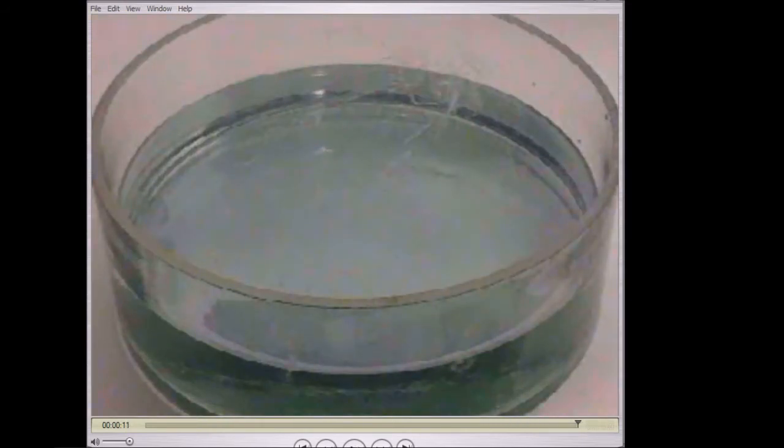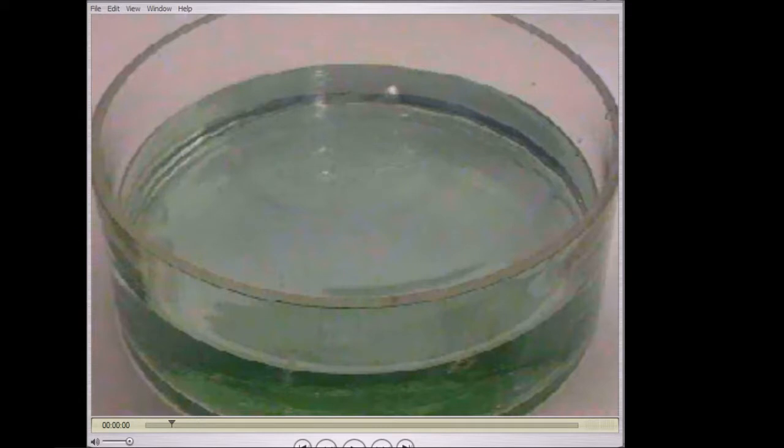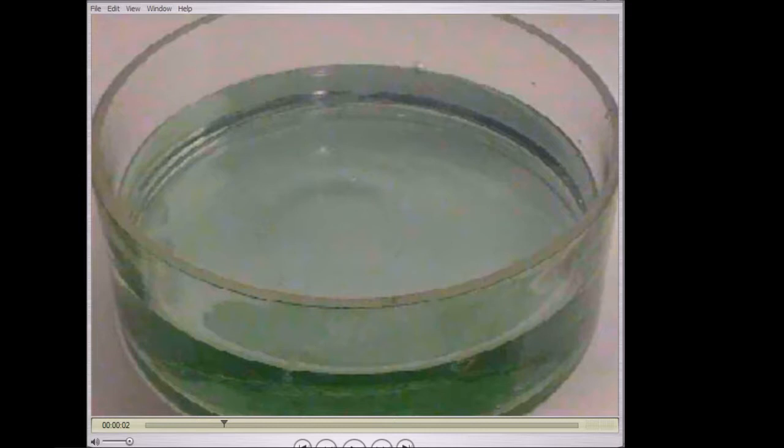Okay, so you can rewind that and have another look at it, but I'll talk you through the main observations now. The first thing is, if we go back, we can see that hopefully the sodium floated. So that tells us that the sodium is less dense than water. That was clear and obvious if we just listen to it here as well. There's definite fizzing. Now fizzing in a chemical reaction tells me that there must be a gas getting produced. We can't identify the gas just yet, but we will be able to soon.